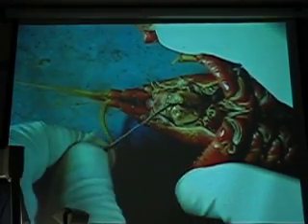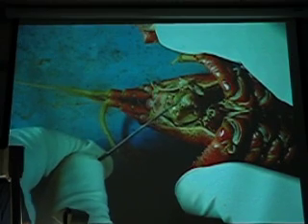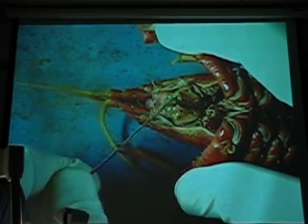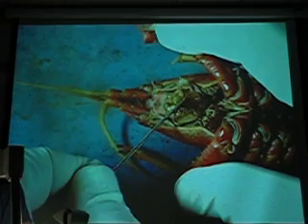Mandible. Oh, it doesn't show up too well. Okay, right here. Right there. Oh, I let it go. What is it? Covers the mandibles.